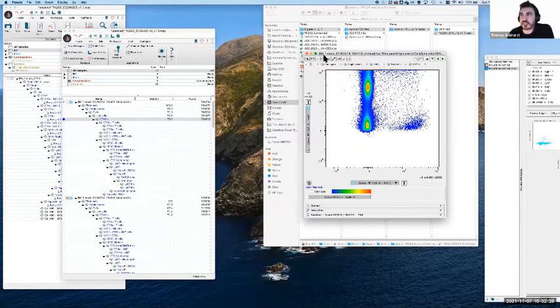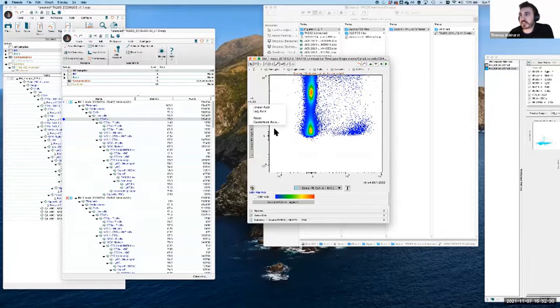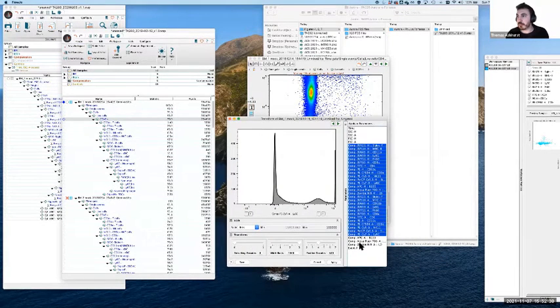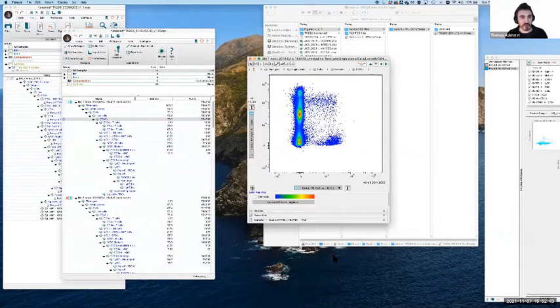The approach is actually very similar. Now, the unmixing itself, let me just correct these back to where they're supposed to be. The unmixing itself, which is done, for instance, on the Aurora, if you're using the Cytek instrument, is done in a very different way to compensation. The actual math behind it isn't terribly different, but the overall process is different.